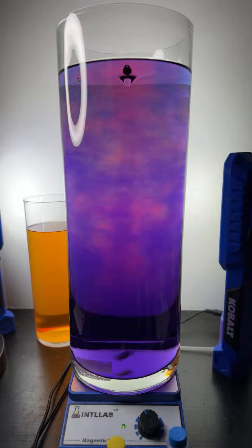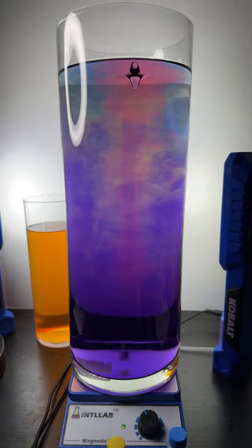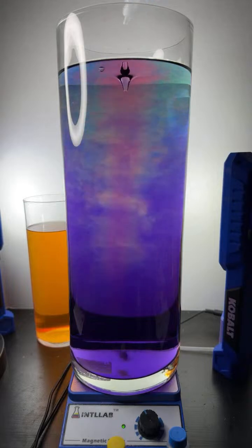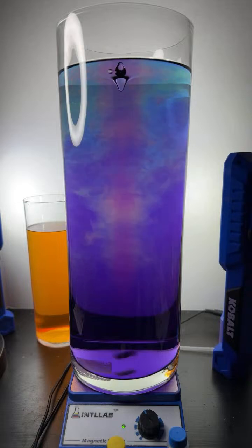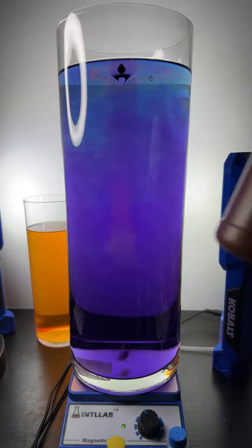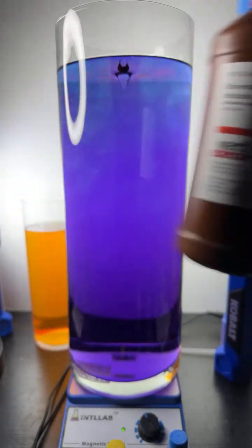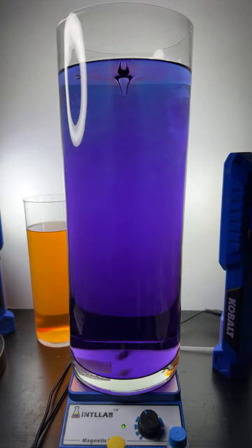Moist, I don't know. This is just a chemistry experiment that I do. All I'm doing is adding. Okay, the indicator I'm using, Shrey, is called Universal Indicator. I bought it from Ward Science. You can see that right there. I'm not selling it, but it's just where I bought it.